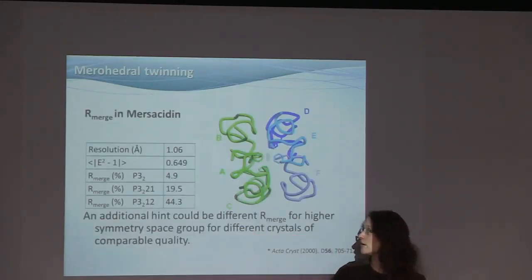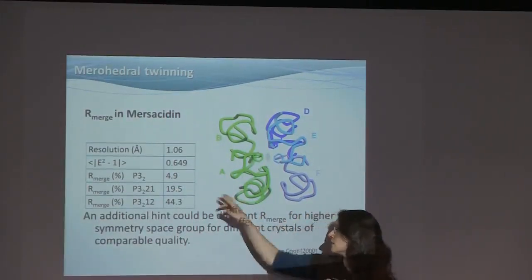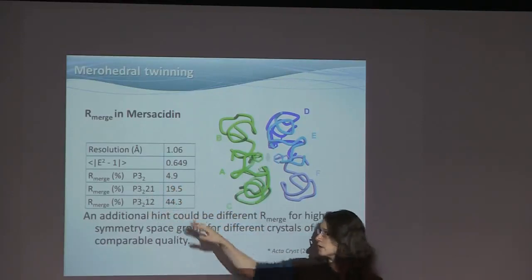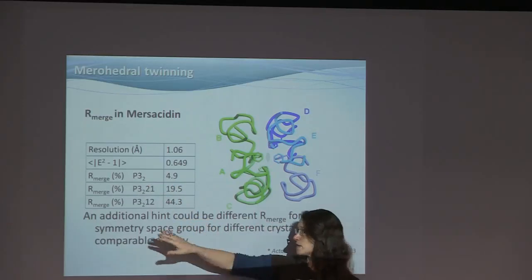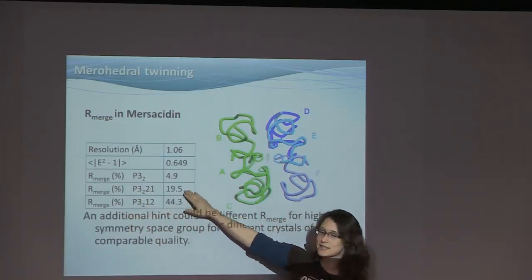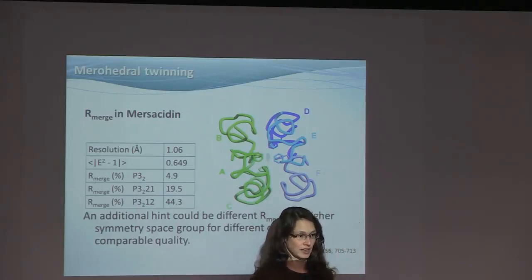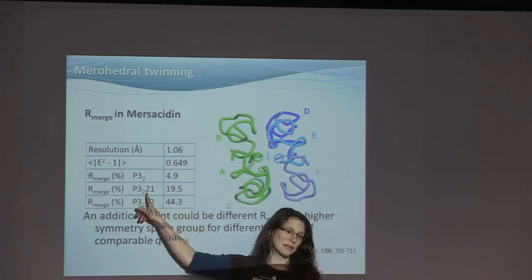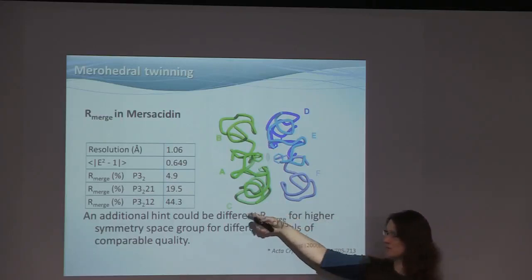Now, Rmerge, I said, also behaves strangely. So you can see that in this case, mersacidin, a small peptide, the E squared minus 1 was below 0.7 something, so it's too low already. But then we integrate the structure in different space groups. Now, for the very low symmetry, for P3, we get 5%. That's good. We believe the crystal has this kind of symmetry, but perhaps the symmetry is higher. So we process it in P3 2 1 and in P3 1 2. And now what you see is that these two values are vastly different. Now, if both of these symmetries were totally not true, they would both have high values, perhaps in the 40s. But the crystal seems to have some kind of resemblance to this. And that's because it's twinned. And that would then be the potential twin law. So this is also a method to find potential twin laws. Behavior like this can often be a hint.